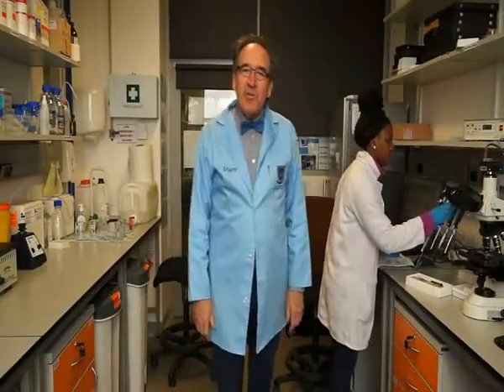Hello, welcome to the Spermatology lab at the University of the Western Cape in Cape Town, South Africa. I'm going to show you today the ideal setup for a spermatology laboratory, but also with special reference to computer-aided sperm or semen analysis. And let's first look at the really very basic requirements.